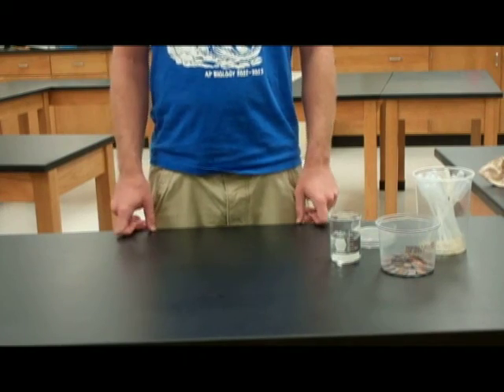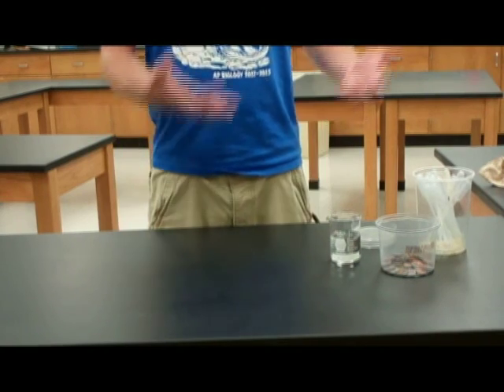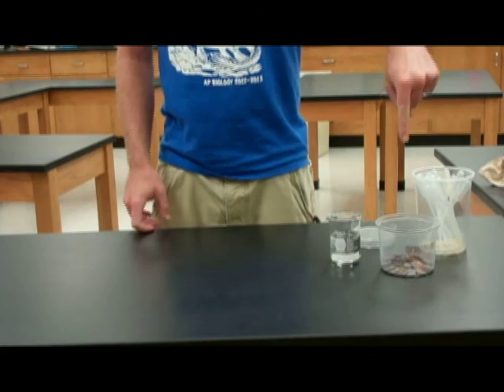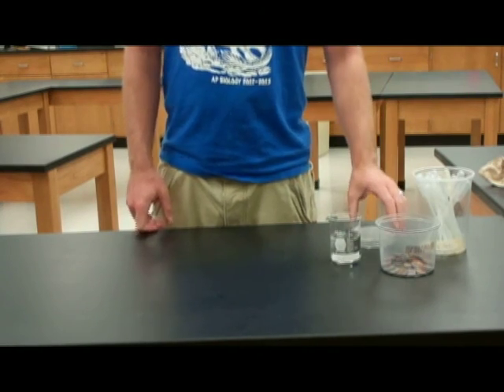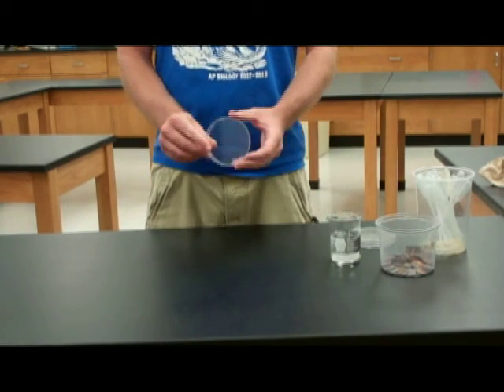Hi, I'm Michael Ralph and today we're going to be doing the Drops on a Penny Lab. You're going to need everything you see right here including pennies, pipettes, and petri dishes.